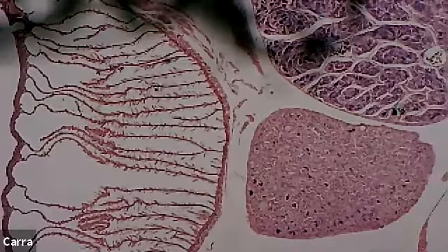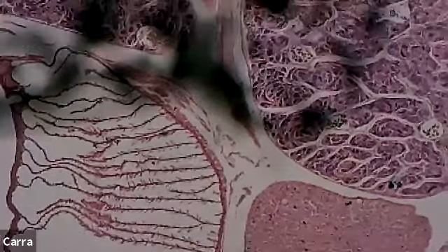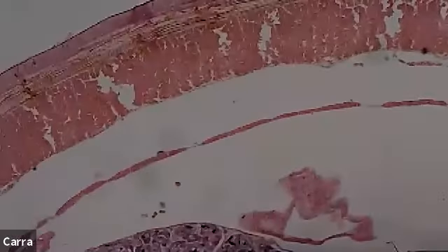It's also going to have all of the different tissue layers in contact with each other. So the mesoderm, the ectoderm, and the endoderm are all in some way connected and touching each other. And that allows for tissue communication. And when we have that coelom and we have that tissue communication, we can have organ formation and a really good amount of complexity in organ formation. So here's more of that coelom, that open space.